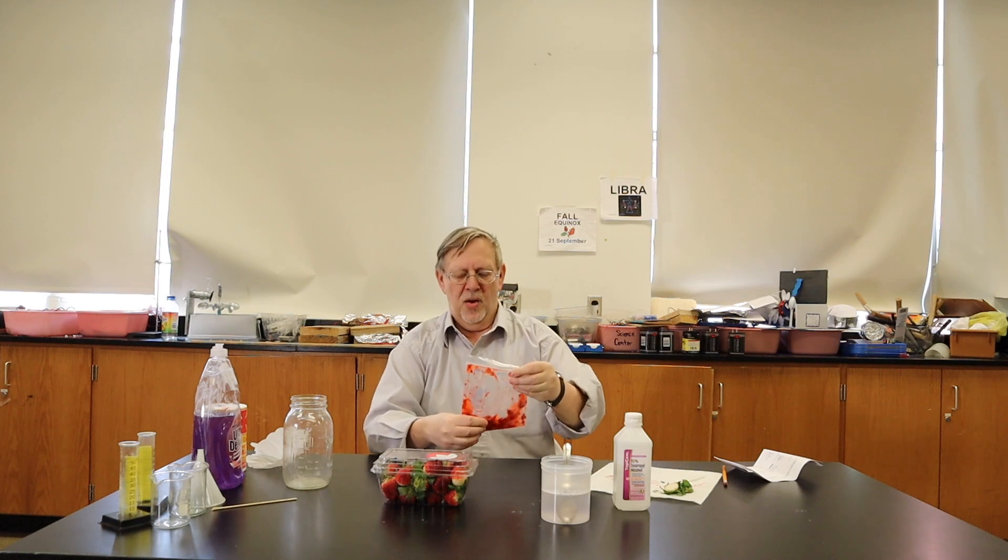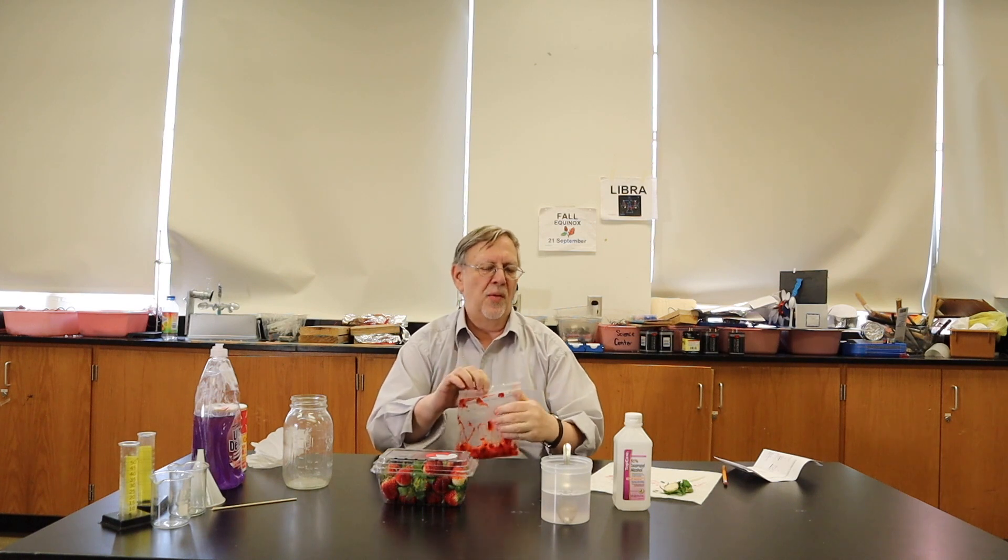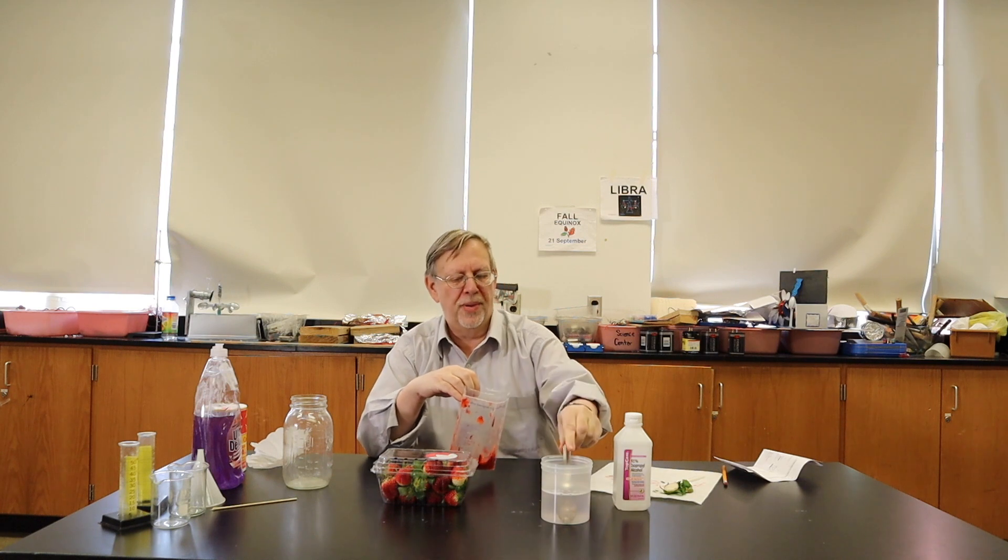Okay, now we have strawberry mush. Now we are going to put the extracting fluid into the bag.